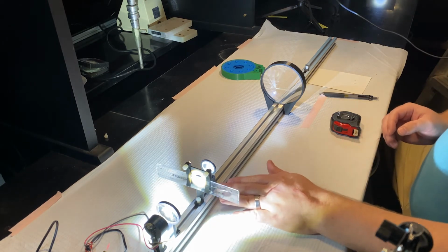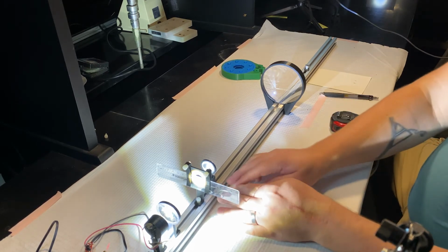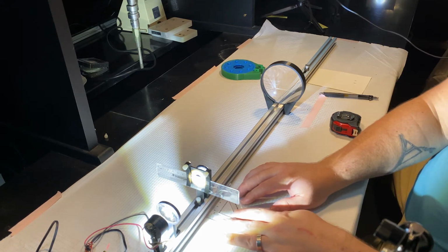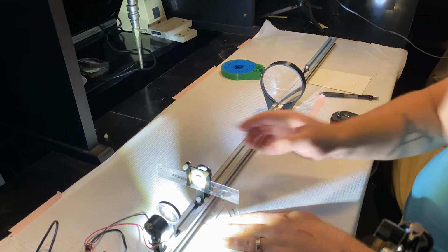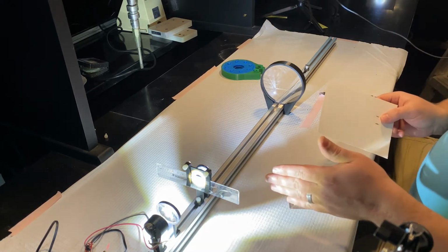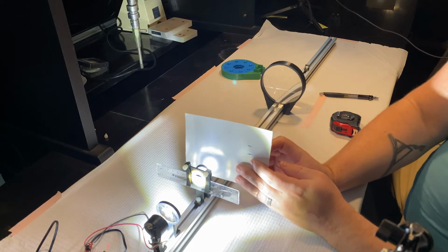Now, our objective lens, as you guys measured in a previous lab, is a 20 millimeter focal length lens. So just a quick little measurement, I'll be making sure that this is around 20 millimeters away from our sample. That looks about good. Now, we know that all the undiffracted light that does not interact with our sample is going to be focused to the back focal plane of our objective, right about there.